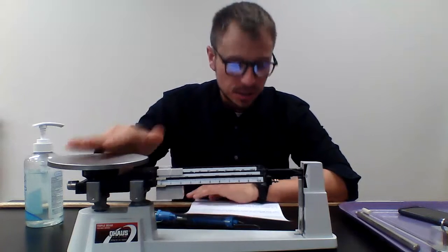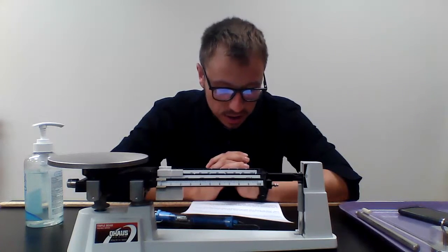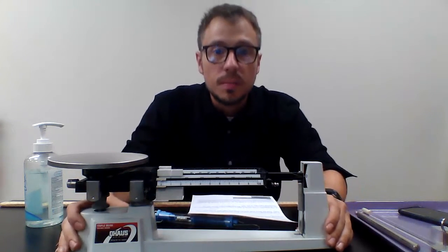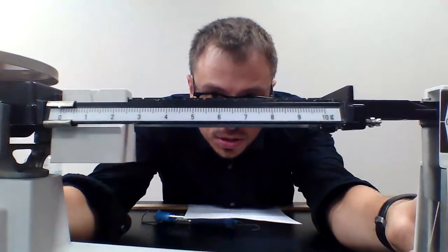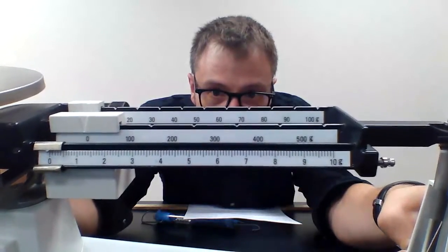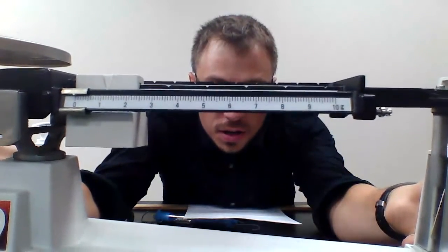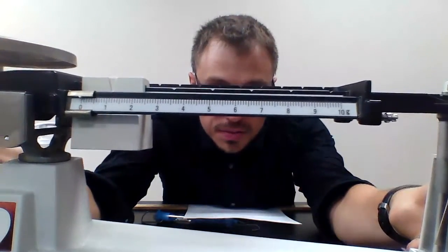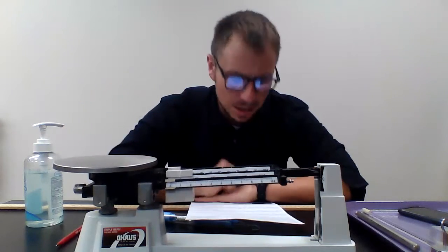Question number two: the triple beam balance is used to measure mass. What is the resolution of the triple beam balance? Does the triple beam balance have an uncertainty digit? Why or why not? Remember, resolution is the smallest interval. There are three beams — one goes by 100, one by 10, one by 1 — but the 1-gram beam is divided up even further. What does each one of those tick marks represent? And tell me if there's an uncertainty digit; remember, it can only occur in analog instruments.